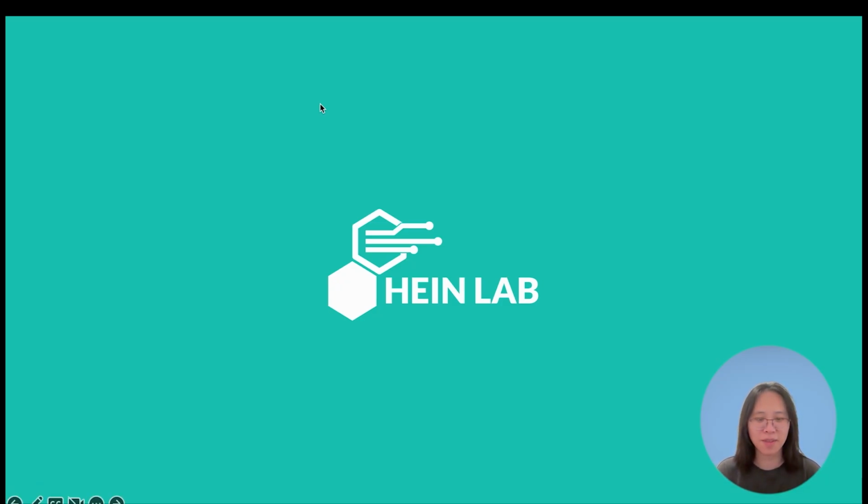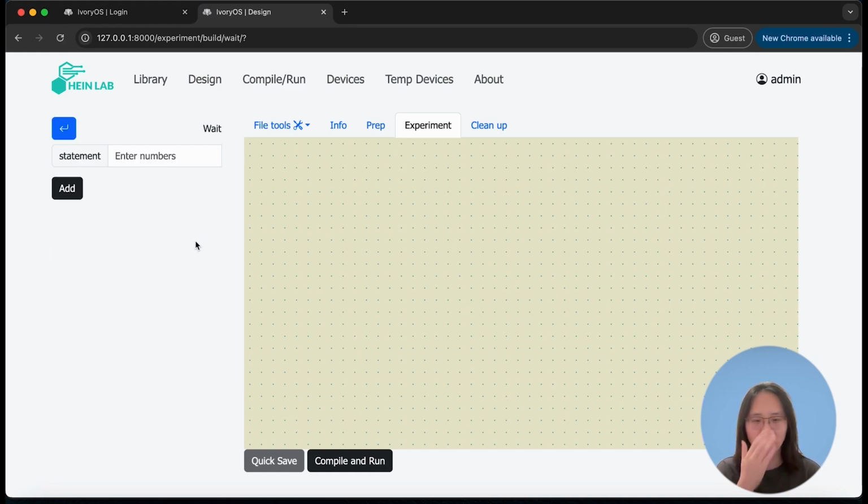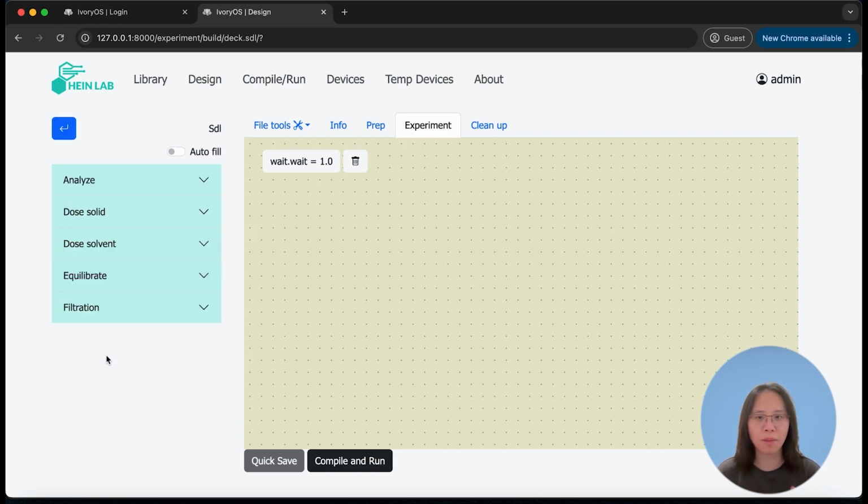So now let's get into the workflow design interface. On this page, on the left-hand side panel, you will see the built-in Python operations like the logic function, or you can set your own variables, or in this wait function, you can set a period of waiting time. So for example, I would just let it wait 1 second and add this to my workflow design. Over the design canvas, you can see 3 options in the top navigation bar: the prep, experiment, and cleanup. These are the 3 phases of one experimental design. Prep and cleanup will only be executed one time before and after the main experiment.